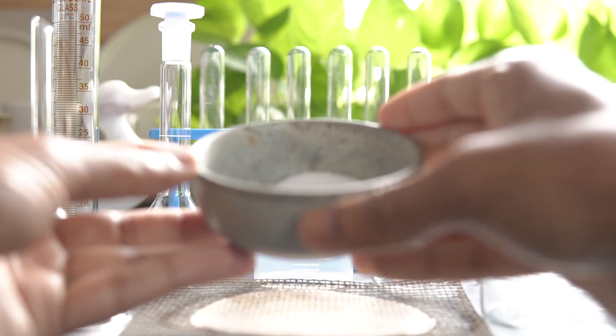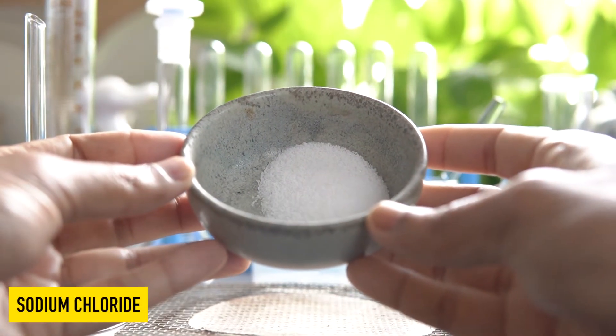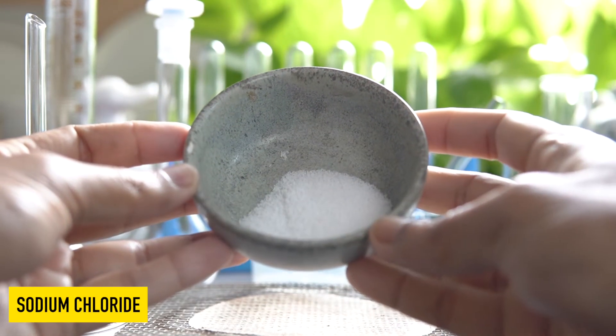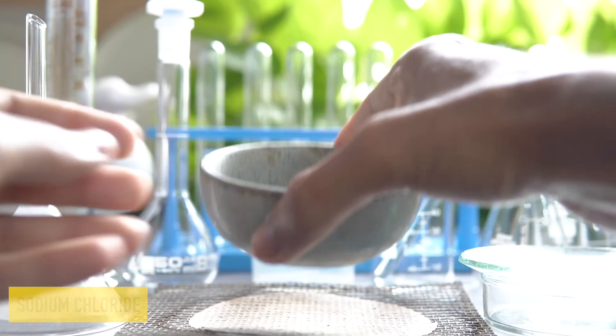The non-sublimable component, here sodium chloride, remains as a residue in the evaporating dish.